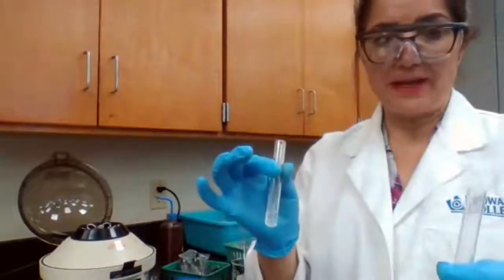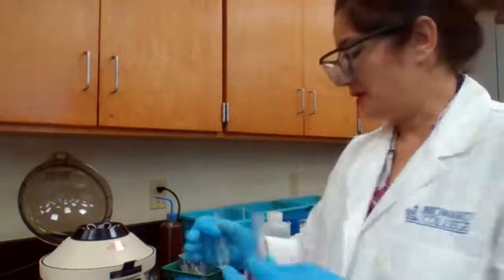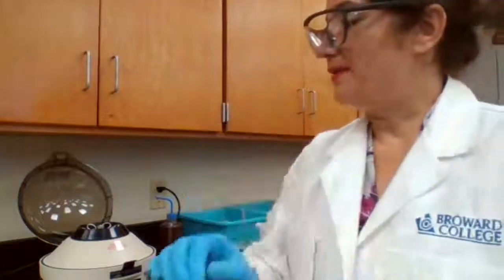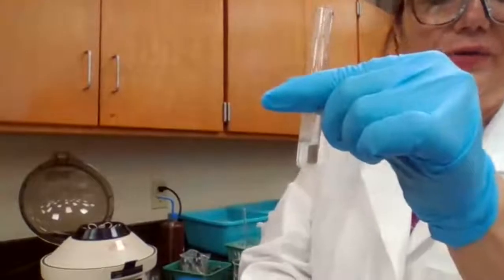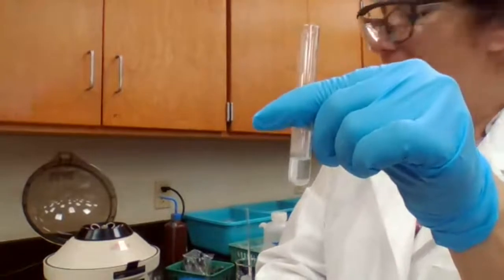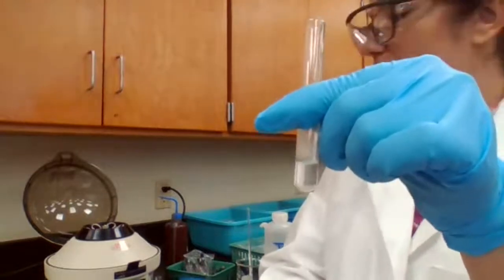This is not confirmed yet, because to confirm it, we have to get a more obvious observation. So for this liquid portion, now I'm going to confirm it. I'm going to report which part of the procedure I'm dealing with now, because it's important, and that is part 1C, confirmation of lead 2+.